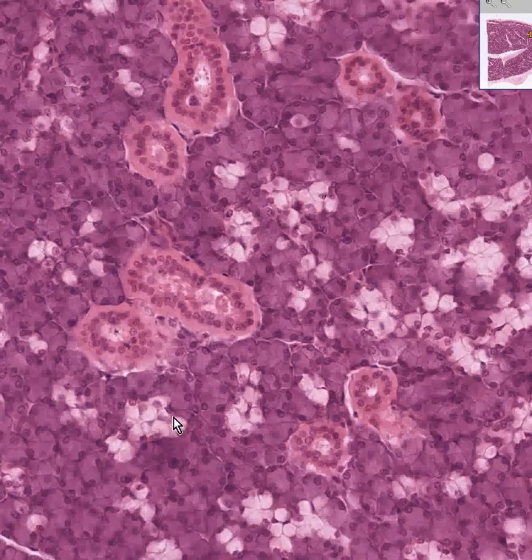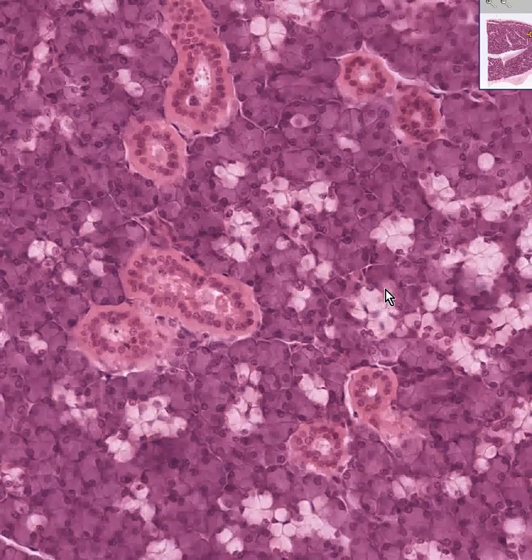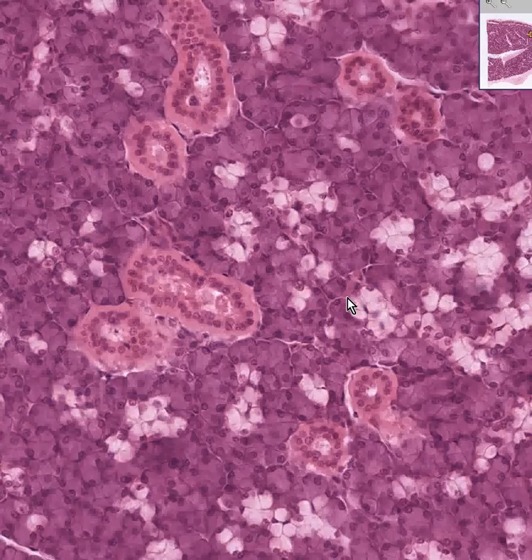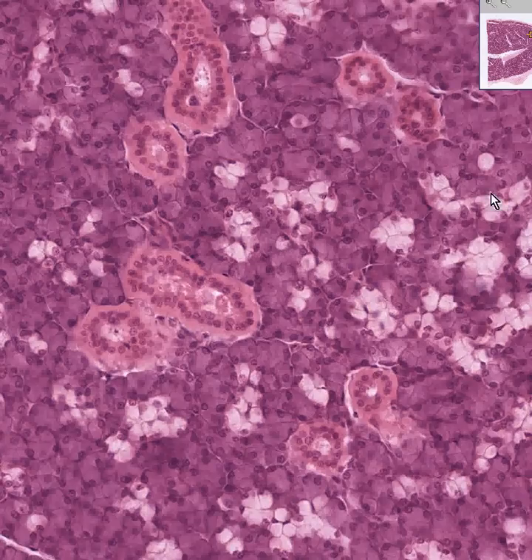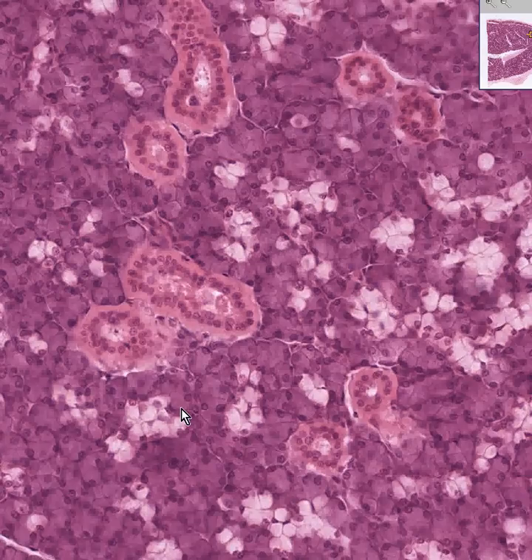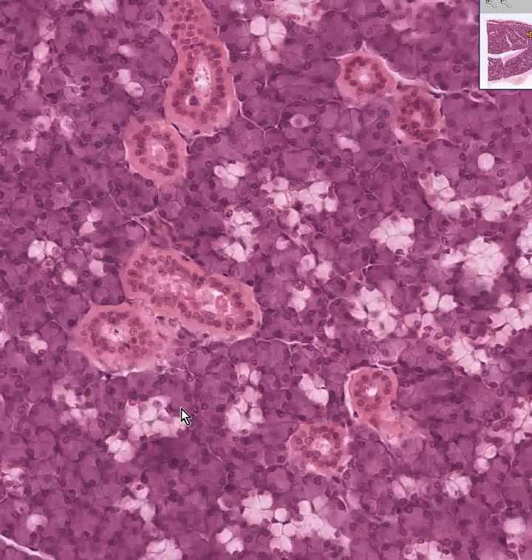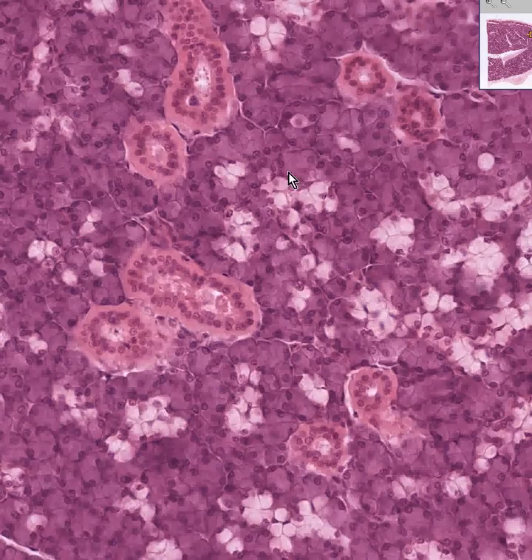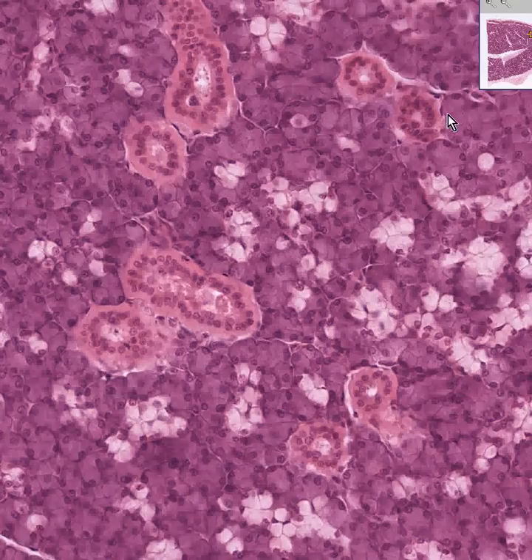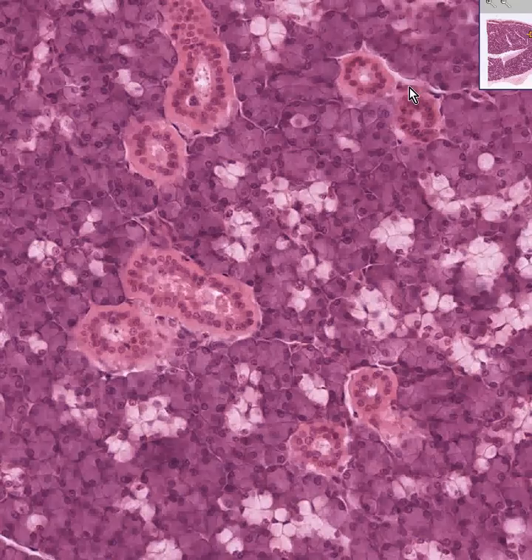The particular salivary gland that is about 50-50 in terms of mucous to serous is the submandibular gland. But actually, there are probably generally more serous elements than mucous — perhaps two to one. You be the judge because you have a representative field.